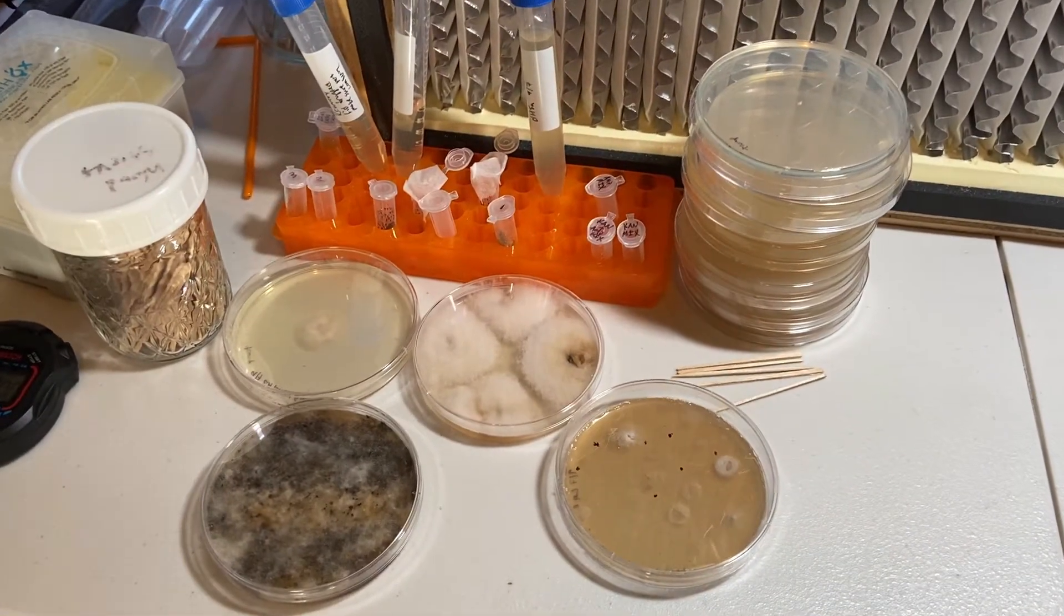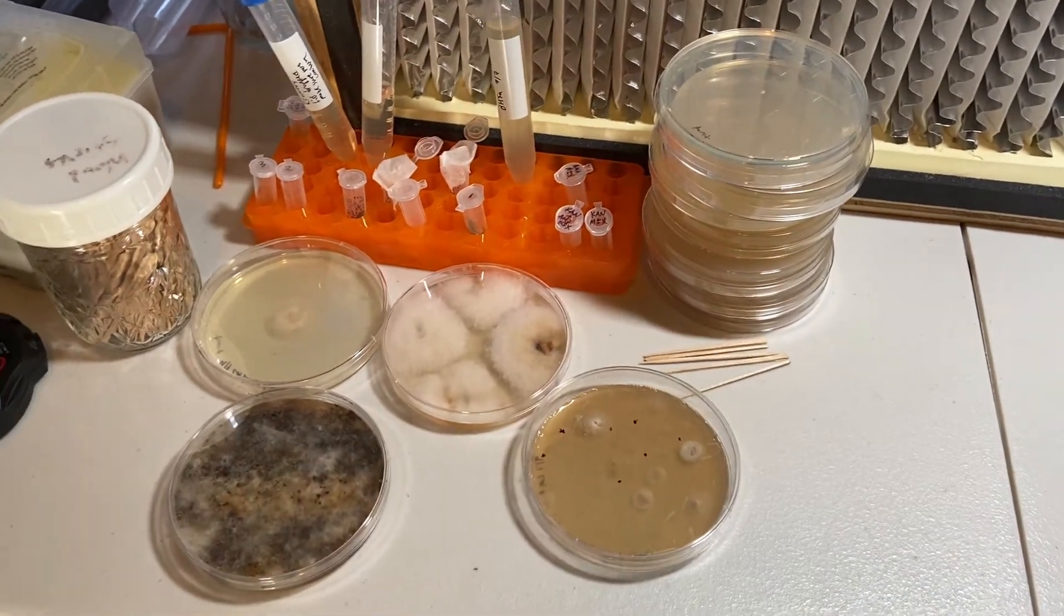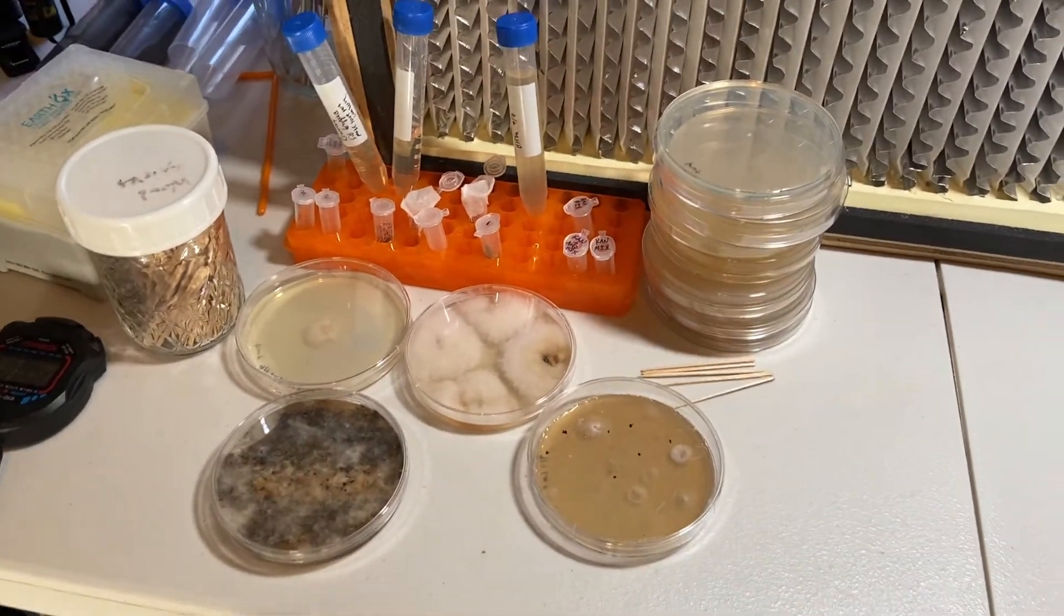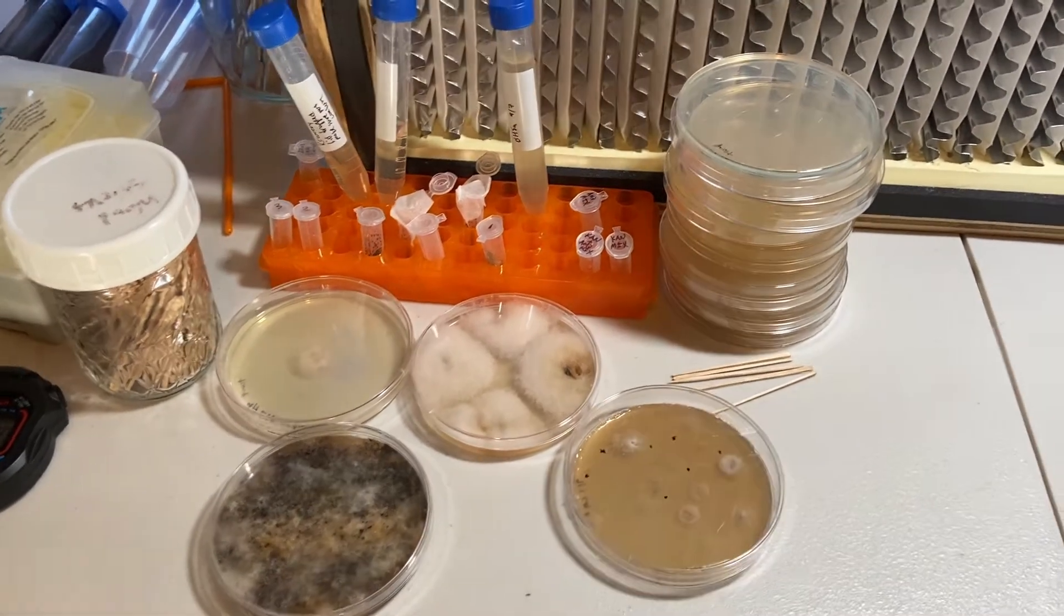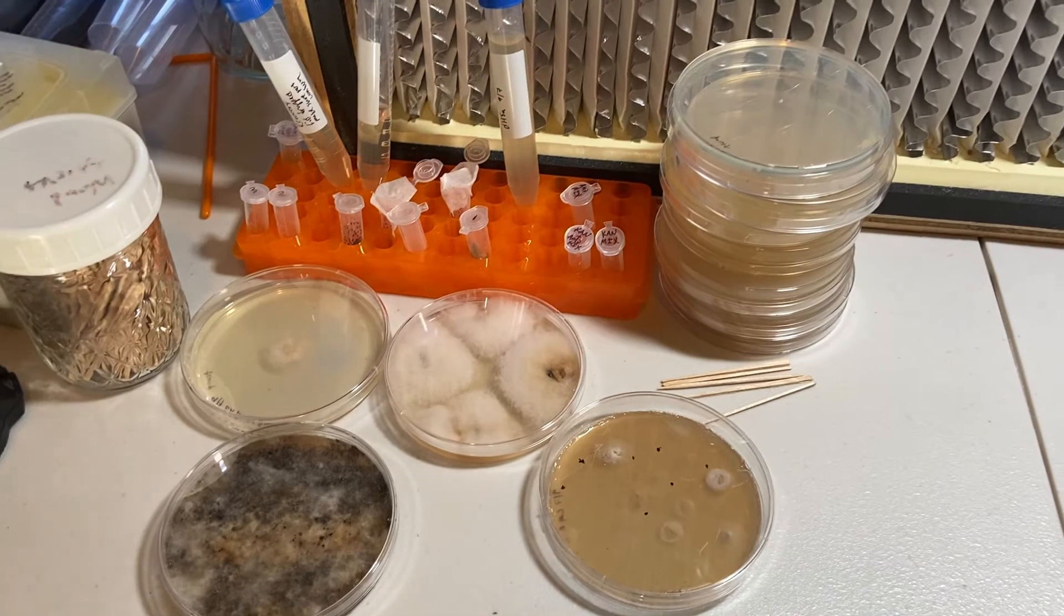That is basically how we do isolation of cultures. I've got those isolated. We'll let those grow out for maybe a week or so, and I'll be posting updates on Instagram. Hopefully we get some cool stuff and see what it does as it grows out.